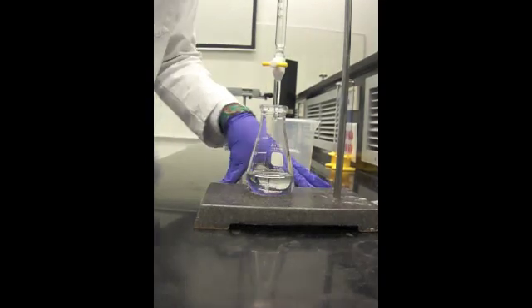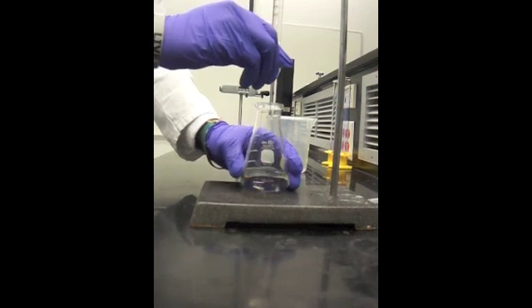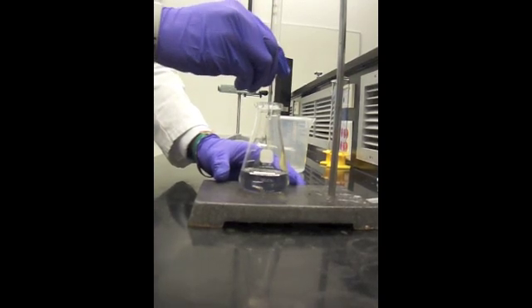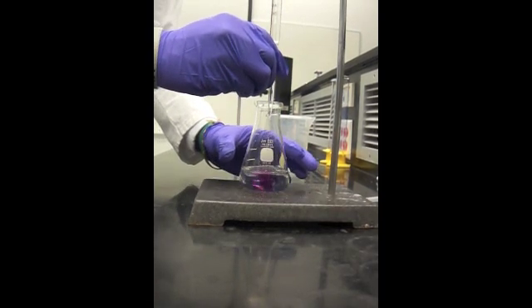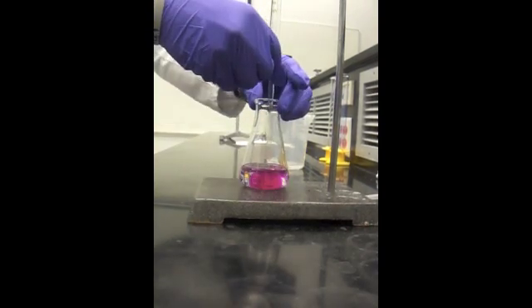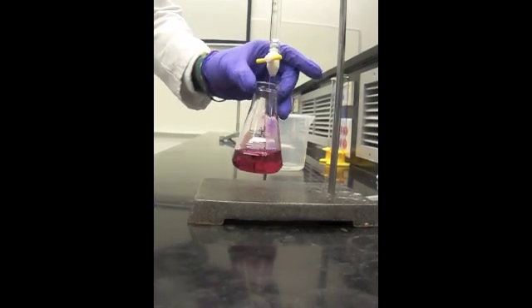As you can tell, it's getting closer to reaching that slightly basic color. Once it gets closer to this state, you want to slow down because if you speed up, the next thing you know your solution is going to be a dark pink.